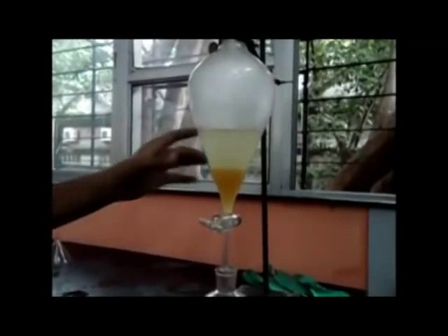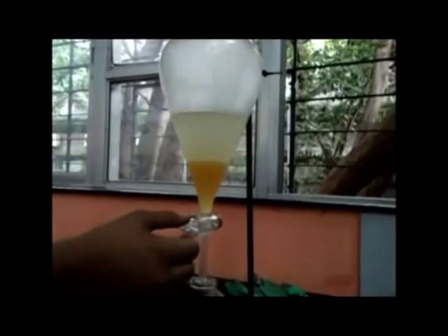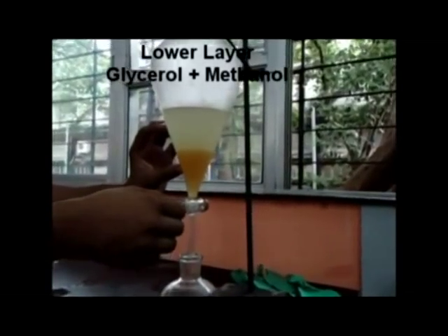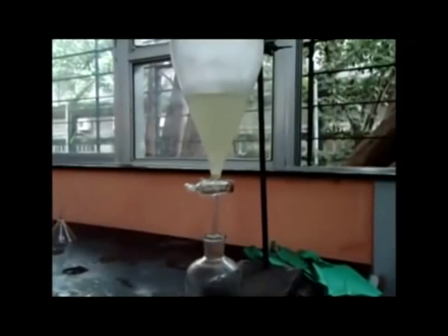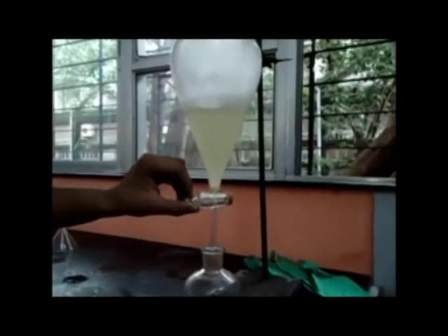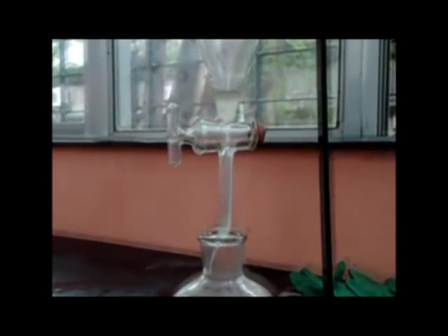The post-transesterification mixture separates into two layers: the lower one consists of methanol and glycerol, while the upper one contains biodiesel, methanol, and other impurities. Collect the layers in different containers and weigh them. The biodiesel layer is now ready for distillation.